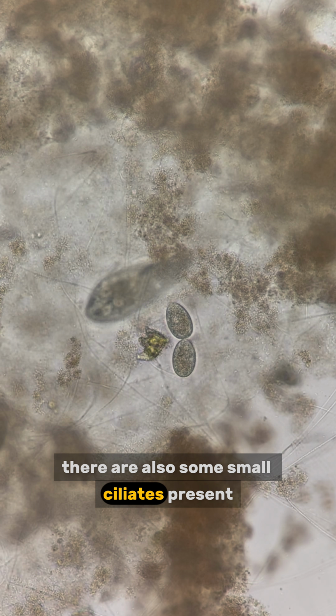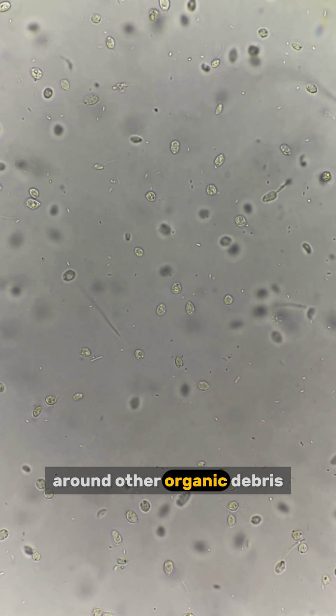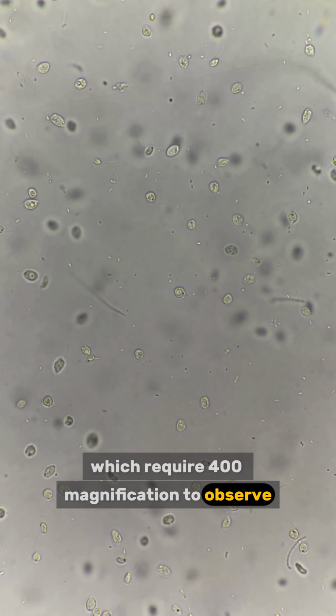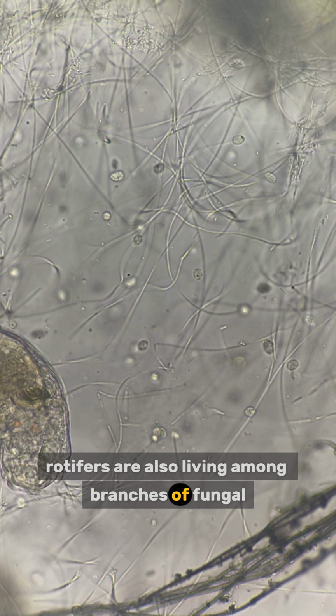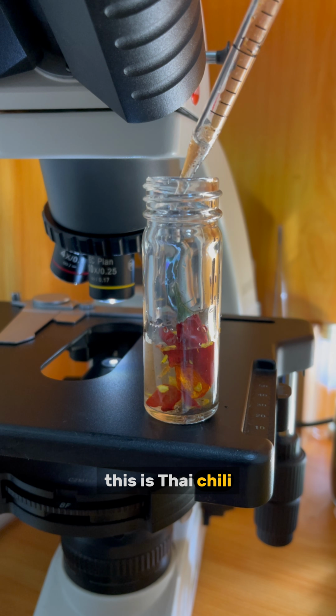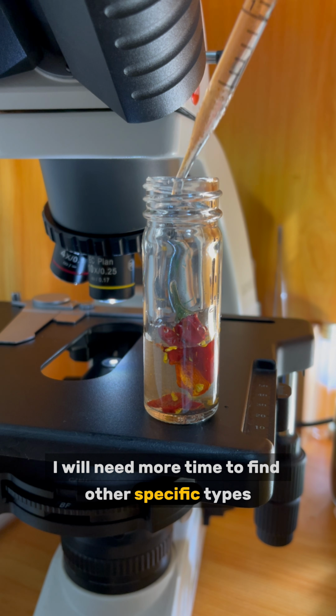There are also some small ciliates present. Around other organic debris, there are mainly these small microbes, which require 400 magnification to observe. Rotifers are also living among branches of fungal hyphae. Let's add stuff. Chili. This is Thai chili. I will need more time to find other specific types.